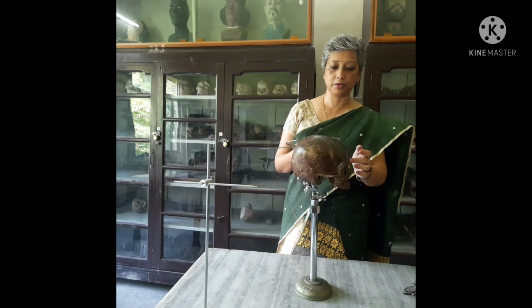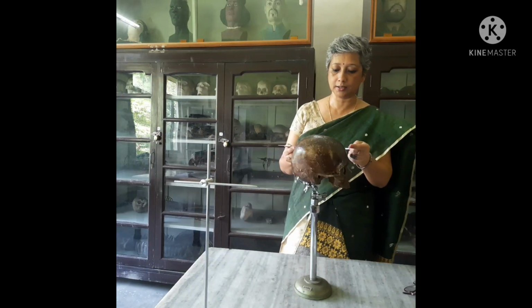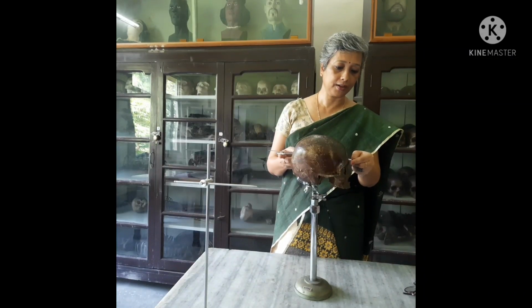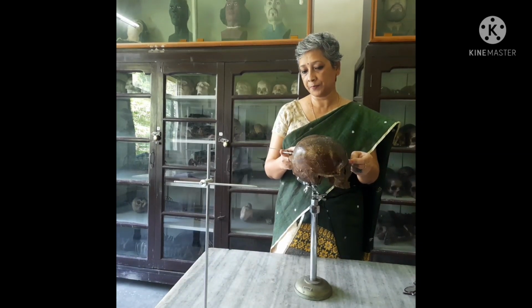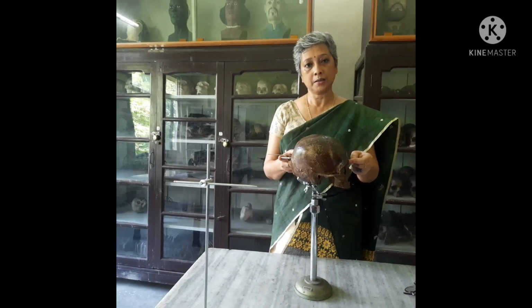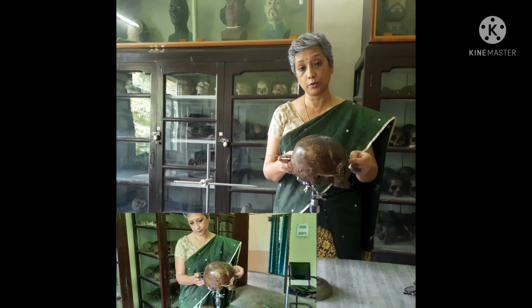So the glabella is the most prominent point between the two supraorbital ridges on the mid-sagittal plane. After locating the glabella, we hold the instrument with our right hand, identify the glabella point and hold that point with the tip of our forefinger, and with the other arm of the spreading caliper we move to find the point, because the opisthocranion is not a point but the part of the cranium which shows the maximum length.